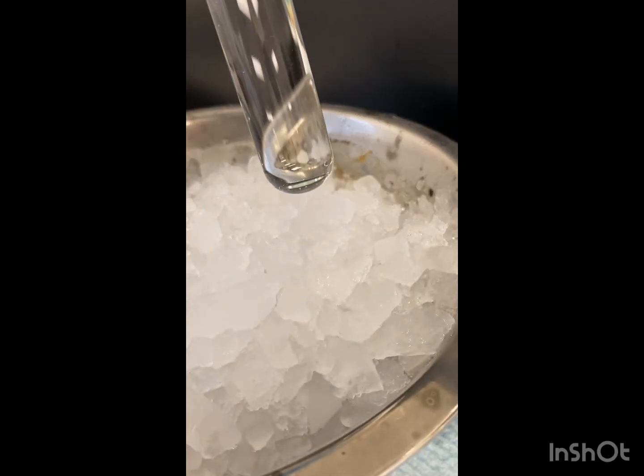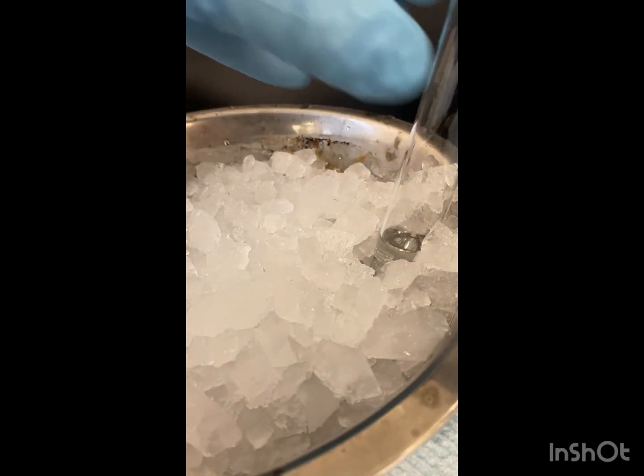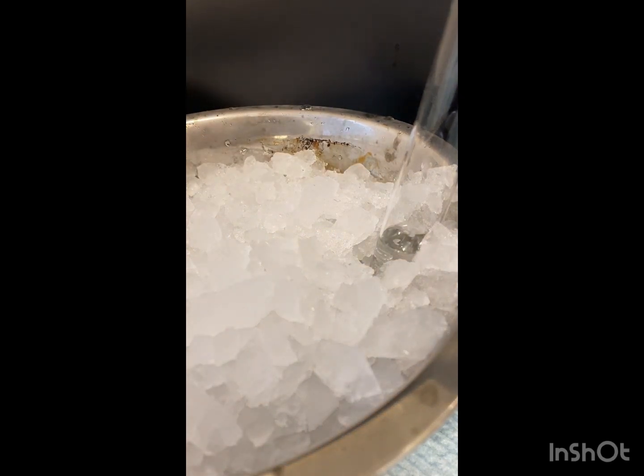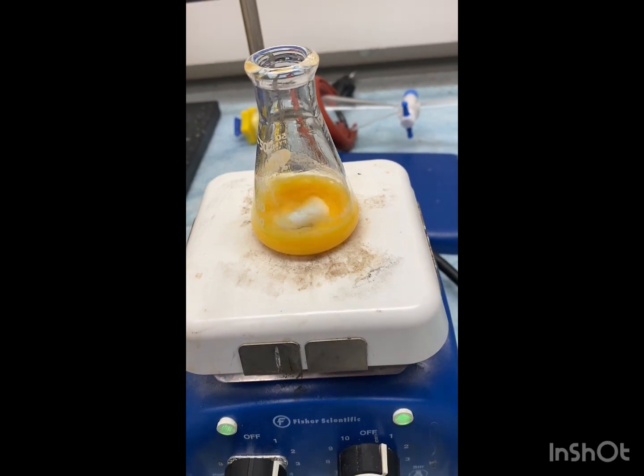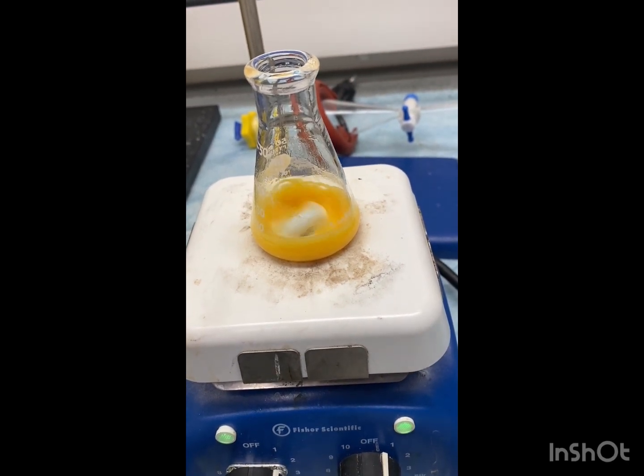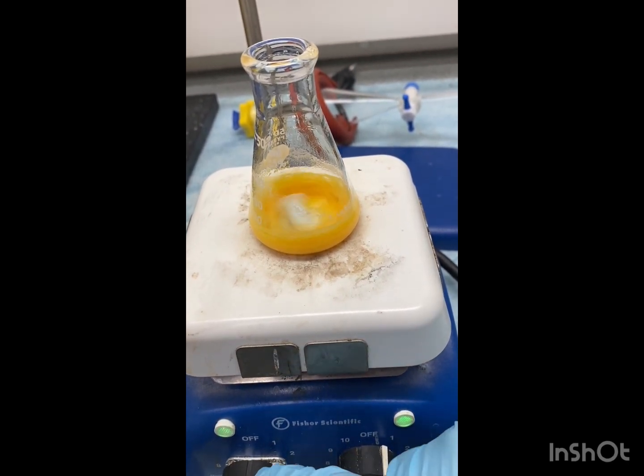All right, this is our methanol. Just going to put it in our ice water bath. All right, so it's been about seven, eight minutes. I'm just going to go ahead and turn the heat off.